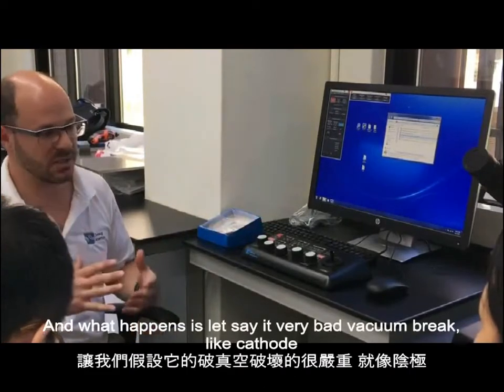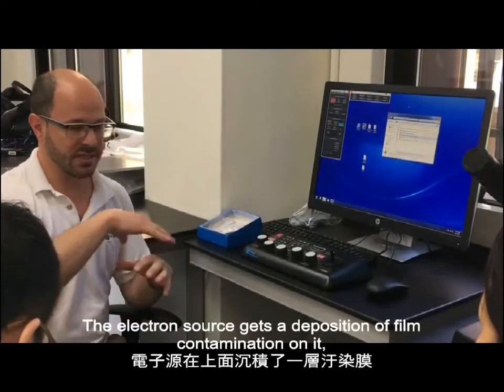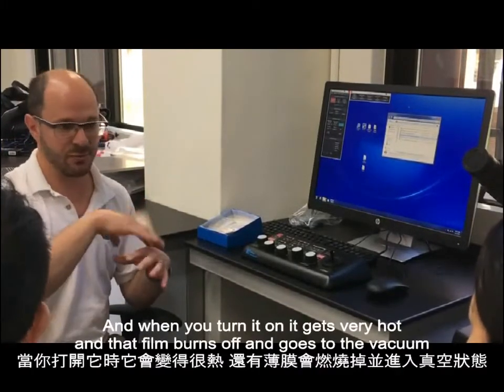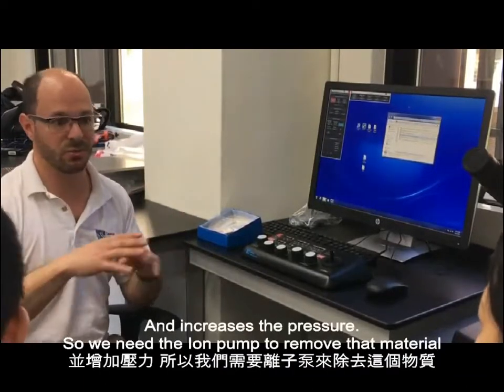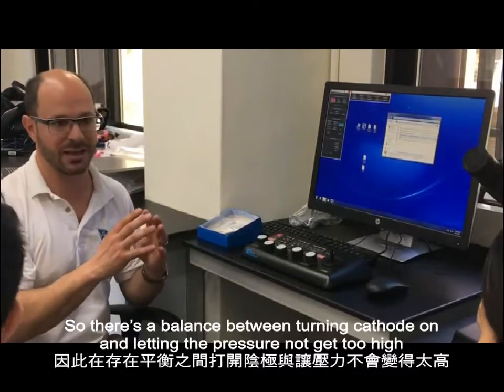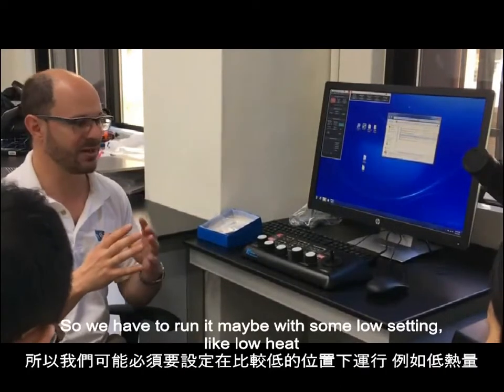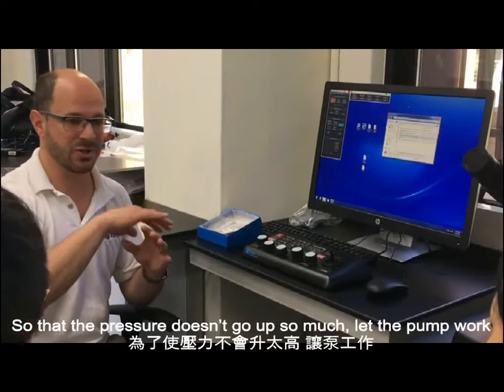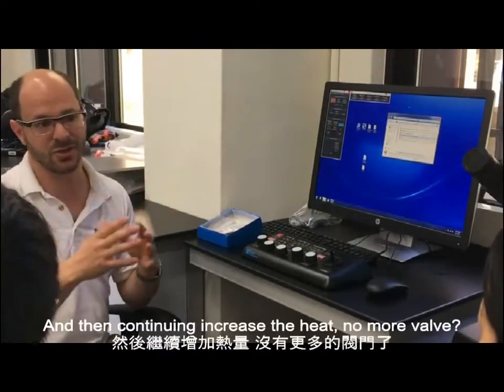And what happens is, let's say it's a very bad vacuum break, the cathode, the electron source, gets a deposition of film, of contamination on it. And when you turn it on, it gets very hot, and that film burns off and goes into the vacuum, and it increases the pressure. So we need the ion pumps to remove that material. So there's a balance between turning the cathode on and not letting the pressure get too high. If the pressure gets too high, it can damage the cathode. So we have to run it with a low setting, like low heat, so that the pressure doesn't go up so much, let the pump work, and then increase the heat. And then let the pump work, and then continue increasing the heat to the normal value.